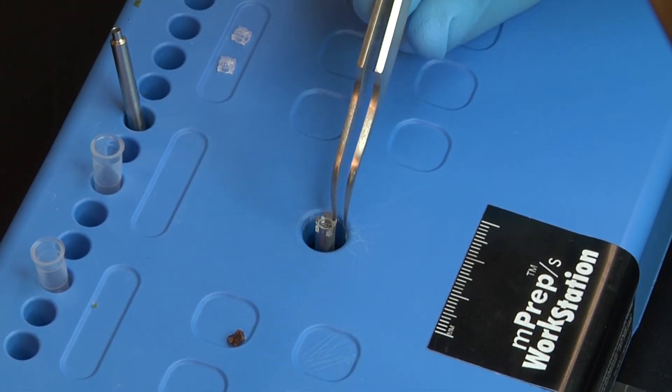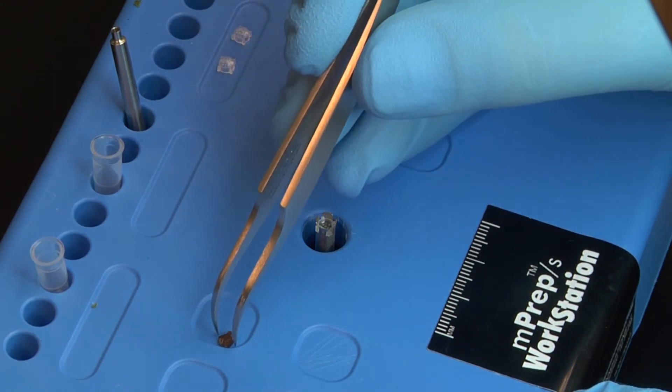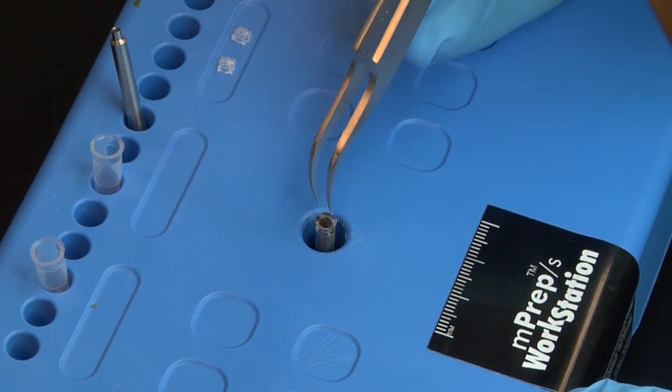This final example shows a dry sample being loaded into the concave screen, and then into the capsule.